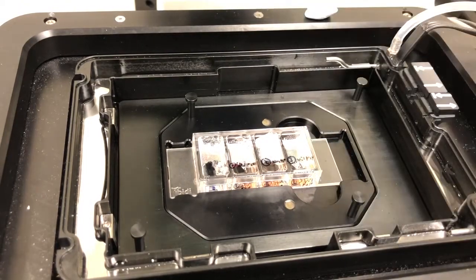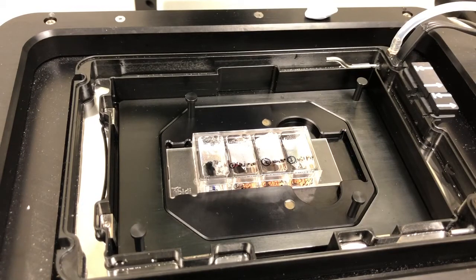I use them to secure three corners of a sample, particularly if I'm going to do live cell imaging, just to add another layer of security to avoid things moving around too much. So I'm going to show you how I do that.